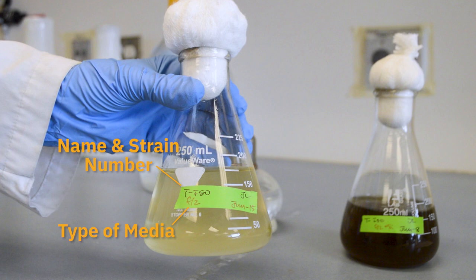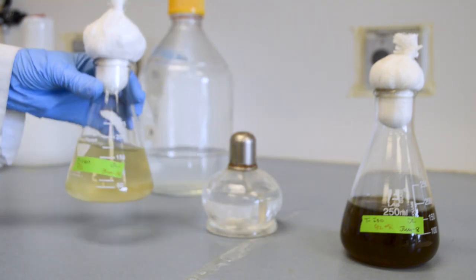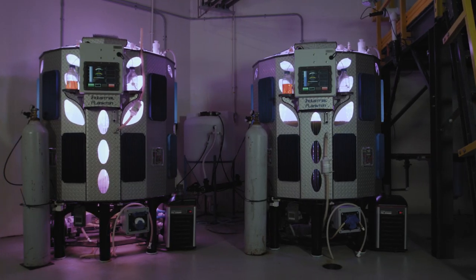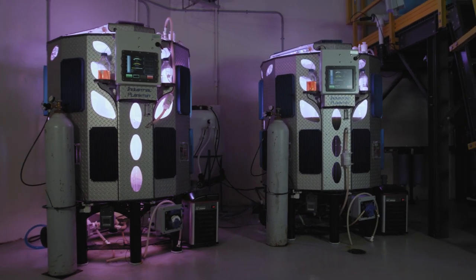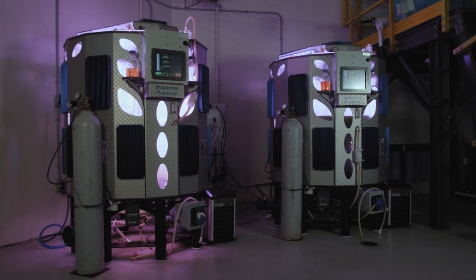Now you have an introduction to the basic sterile transfer of algae cultures. Remember that proper cleaning and sterilization of equipment, minimizing sources of contamination, and minimizing the time sterile containers are open goes a long way towards growing clean algae.